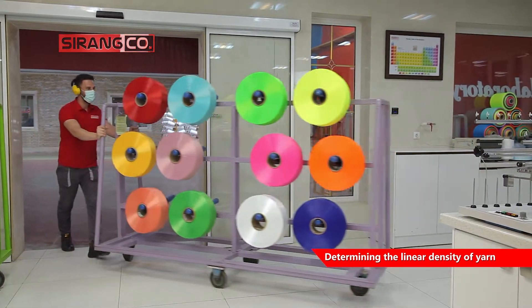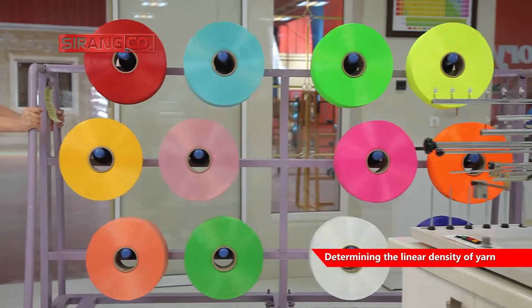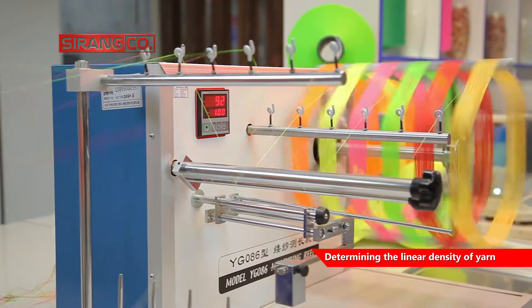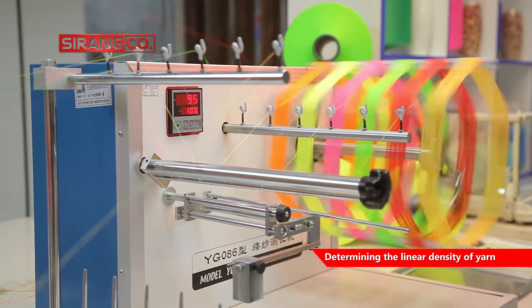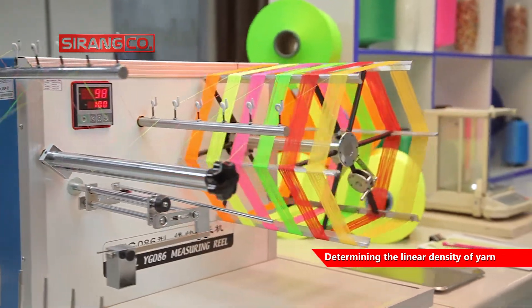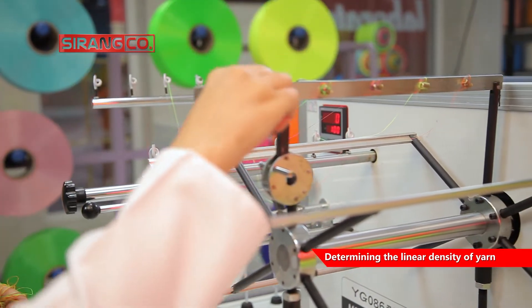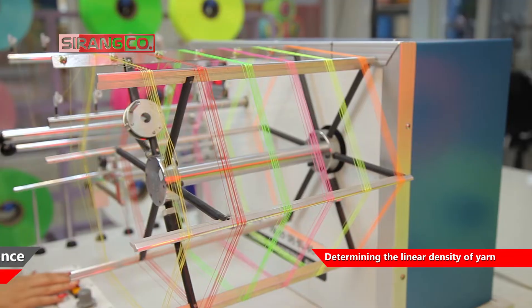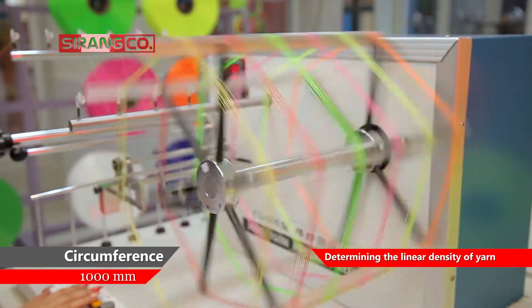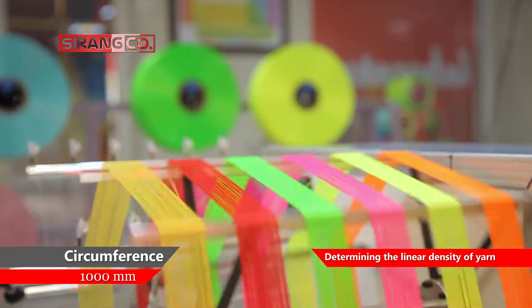To determine the linear density of yarn, it is necessary to have a certain length of yarn, which is obtained using a wrap reel machine. This machine consists of a regular metal hexagon with a circumference of 1000 mm or 1 m.